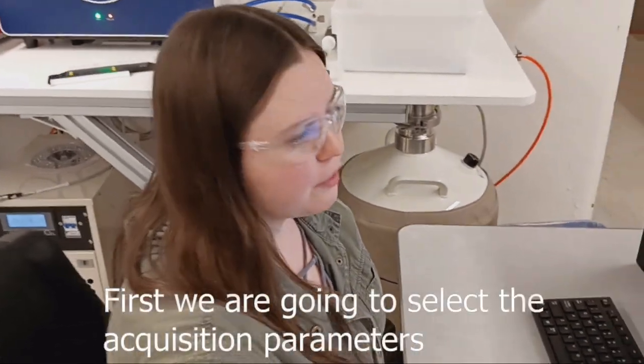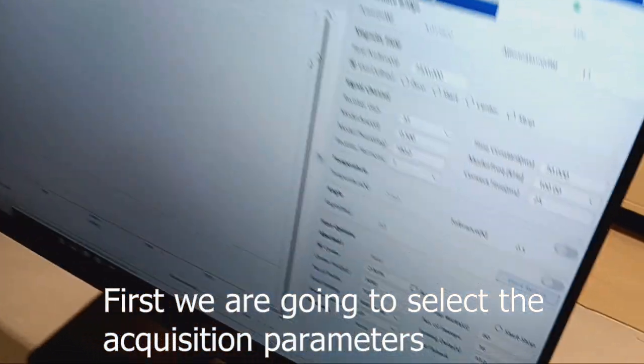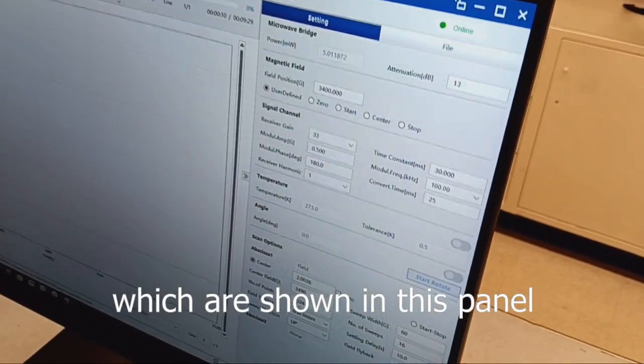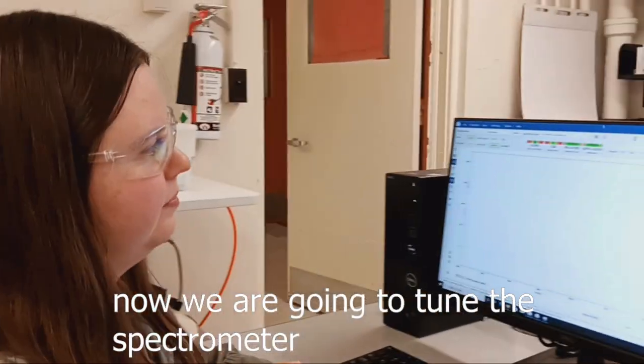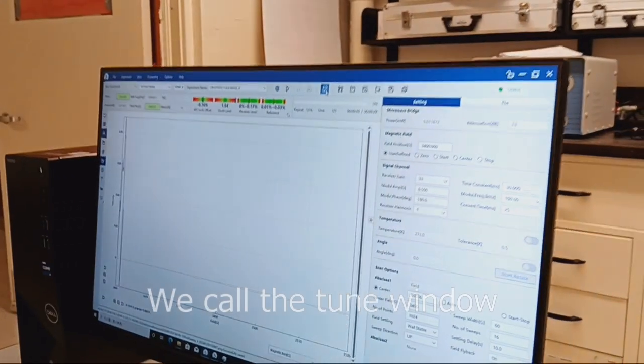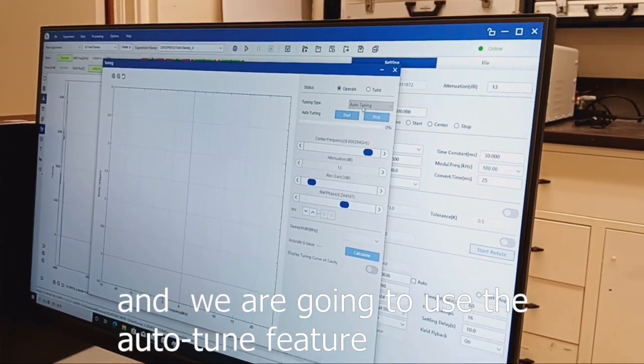First, we're going to select the acquisition parameters, which are shown in this panel. After the acquisition parameters, now we are going to tune the spectrometer. We call the tune window, and we are going to use the auto tune feature.